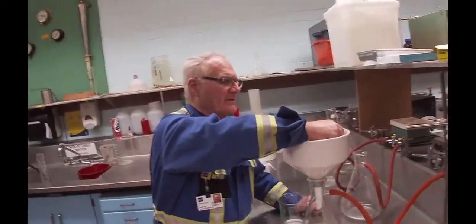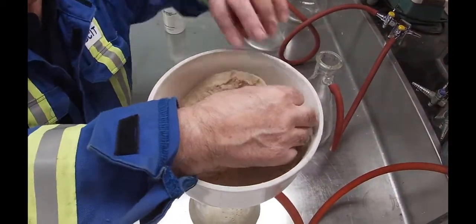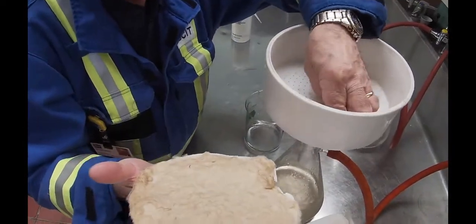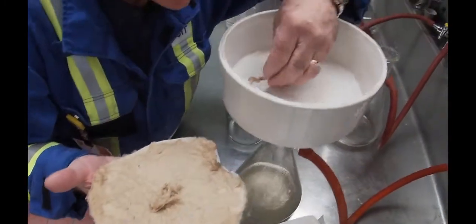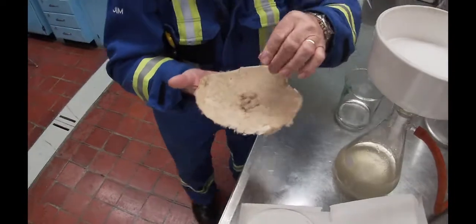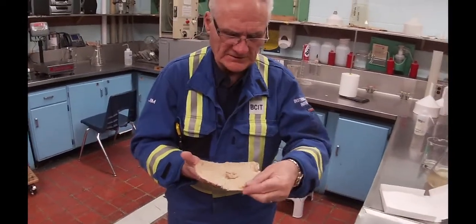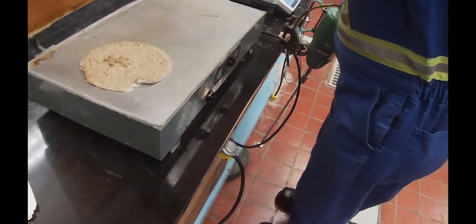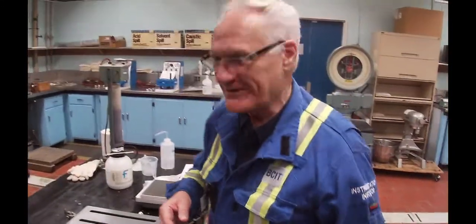It's pretty well done. I'll put my fingernail and peel back the filter. Looks like it leaked around the edge — shouldn't have happened. We're going to do three of these anyway, so it will happen. What happened was that the fiber got in underneath there. This is going on the hot plate. I'll write on the back that this was number one.